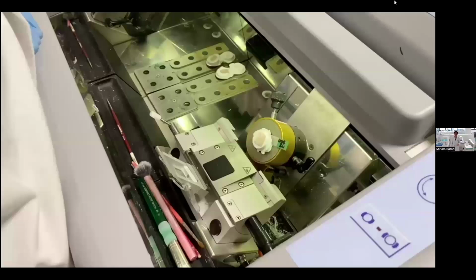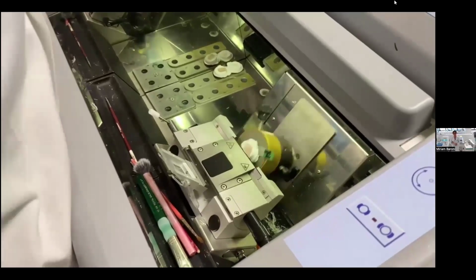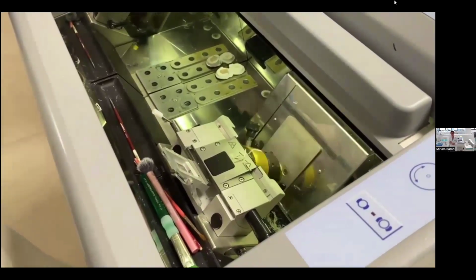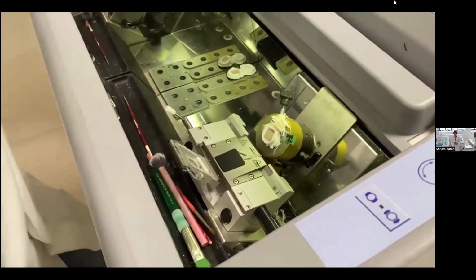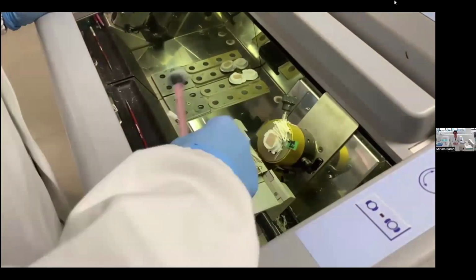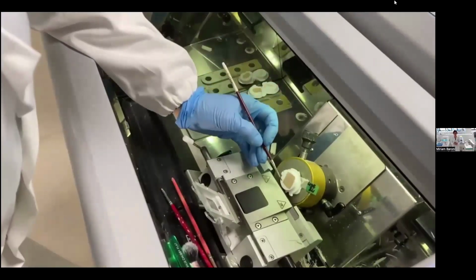And in fact, now I want to show you how is the cutting of a PrestoChill block in the cryostat. As we have seen, the PrestoChill block is flat and requires less trimming with respect to a block prepared in the conventional way. It is also easier to section because the surrounding medium adheres well to the specimen, because I used the MCC medium.